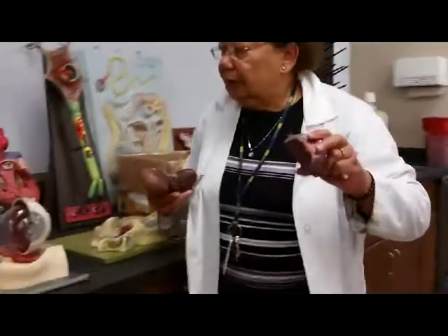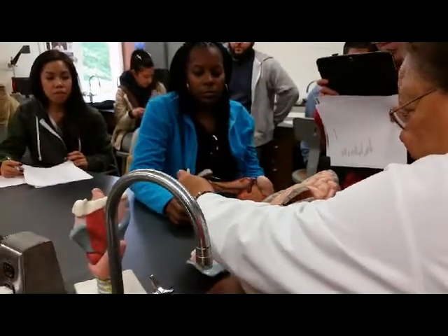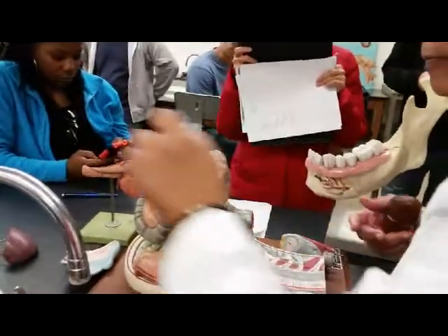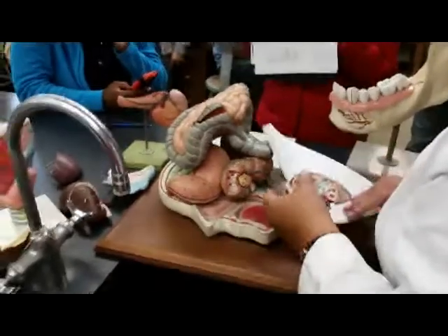See, it's very easy. Spleen is on your checklist. It actually came from the end of the pancreas, so it sticks out there. You only have one spleen, on the left-hand side of the body. That's the spleen. Here's also the spleen. Now let's do the urinary system.